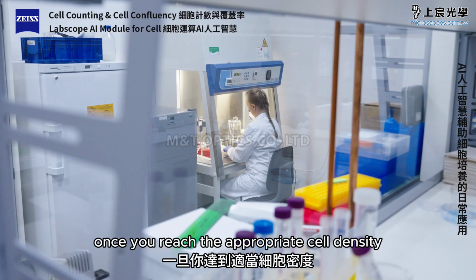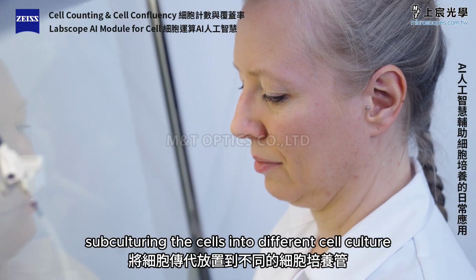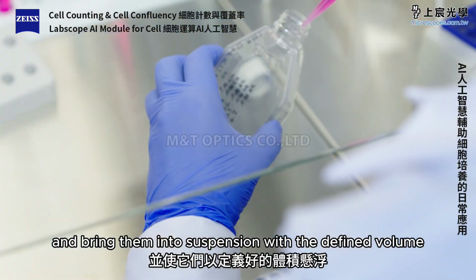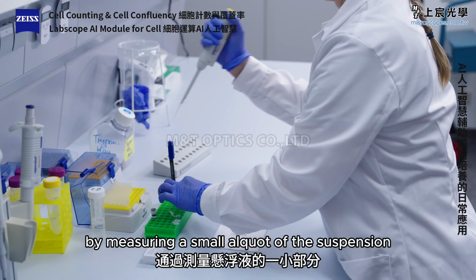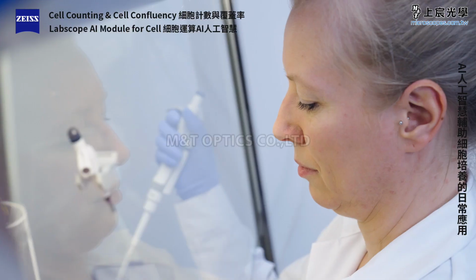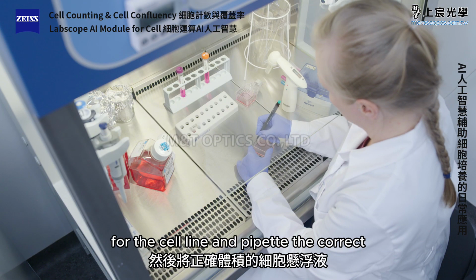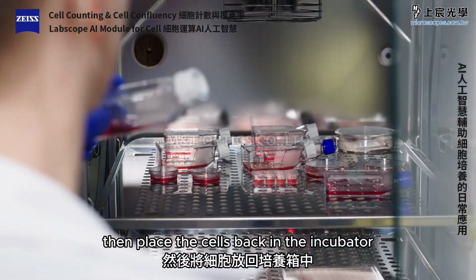Once you reach the appropriate cell density, you can start subculturing the cells into different cell culture vessels. Use trypsin to detach adherent cells from the bottom of the vessel and bring them into suspension with a defined volume. By measuring a small aliquot of the suspension, you can determine the cell concentration in a cell counting chamber. Finally, dilute the cell suspension to the recommended seeding density for the cell line and pipette the correct volume into different cell culture vessels. Then, place the cells back in the incubator.